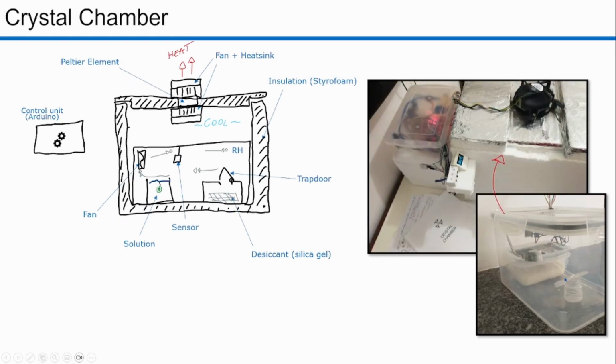So this airtight box goes inside the chamber, right? And here's the unit. Here is the box, and the heat pump pumping out heat from the box. And this is a little monitor that I'm making to check the progress and how things are working. And there is also a sensor over here to check environmental conditions to regulate the power of the Peltier element.